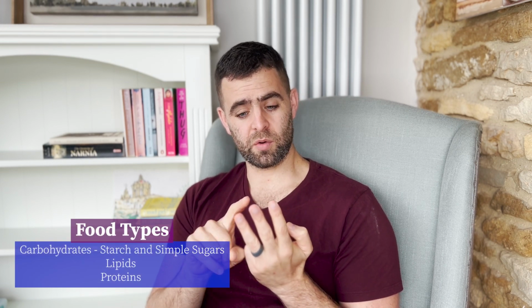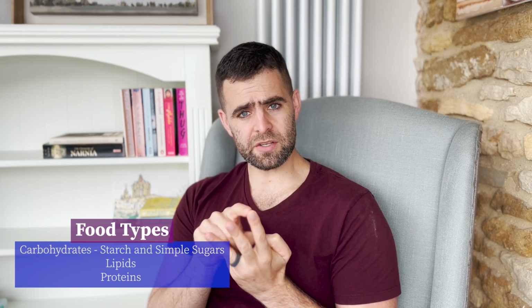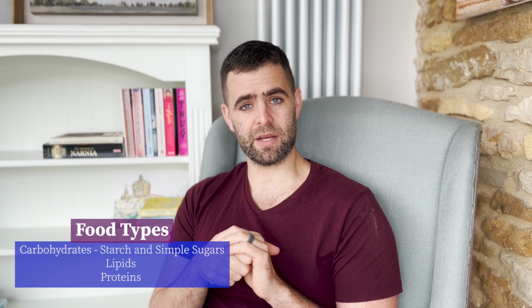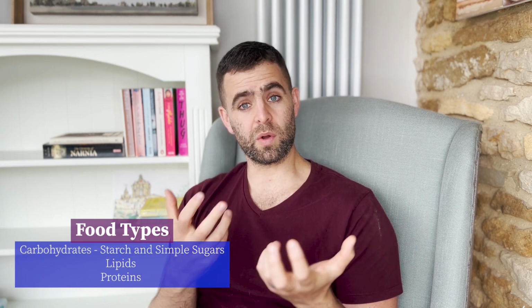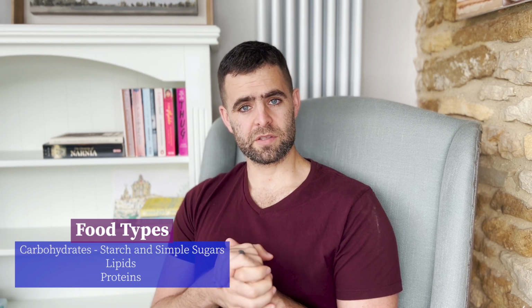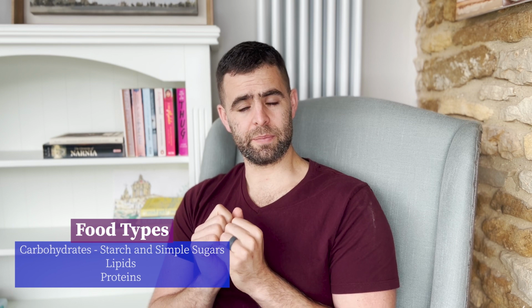So we need to know what substances we're going to be testing for. We talked about having carbohydrates, proteins, and lipids as our 3, right? So we're going to do a protein test. We're going to do a lipid test. With carbohydrates, we're going to look at 2 different types of carbohydrates. We're going to look at starch, and we're going to look at simple sugars, once we've broken the starch down. So 4 tests we'll do: starch, sugar, protein, and lipids.